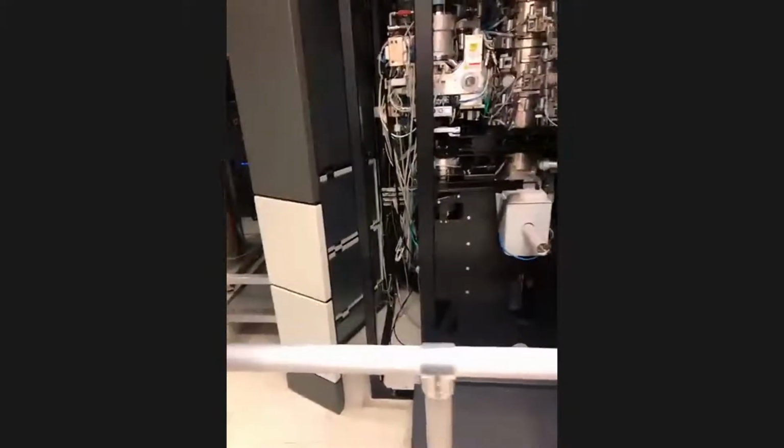So this is a really nice example of the type of infrastructure that the CNSI provides that most institutions, certainly individual faculty members or small companies, couldn't afford. And we have collections of these microscopes. We don't only have Ferraris, we have Fords as well, right? I guess I shouldn't say that having just watched Ford versus Ferrari, because there are some fast Fords as well. But nevertheless, we do have different levels that apply to different areas.